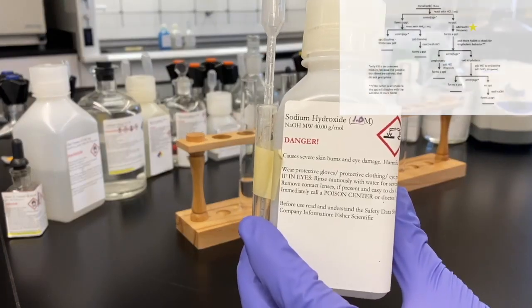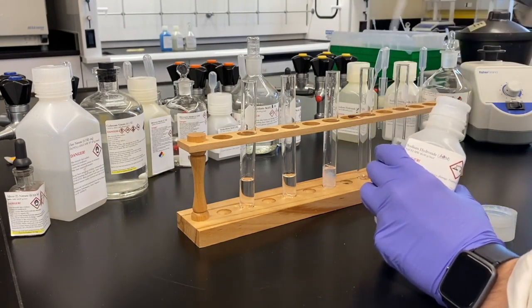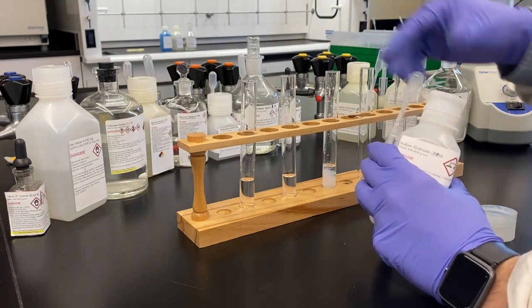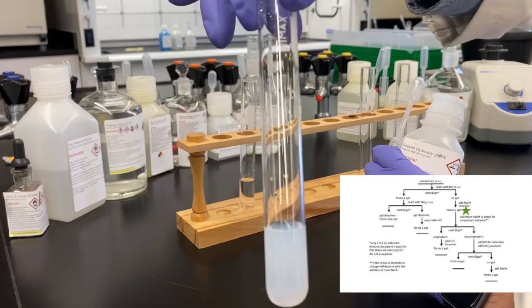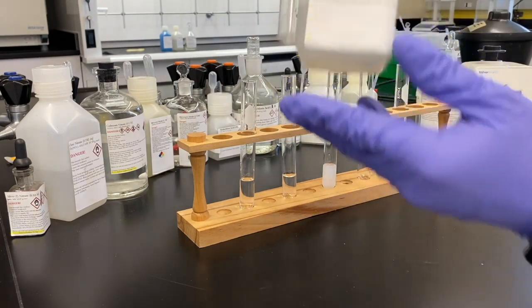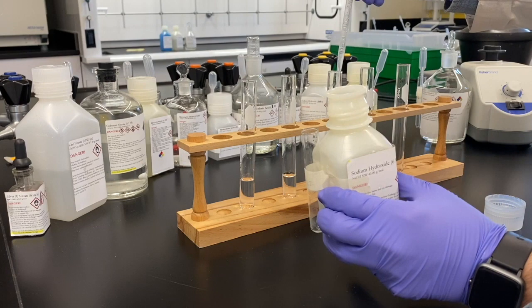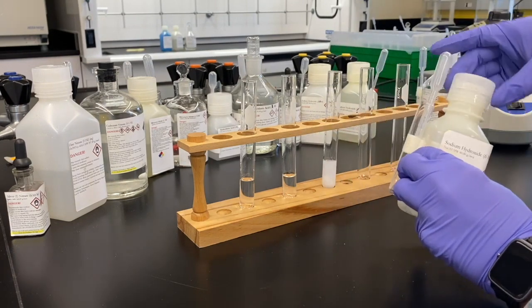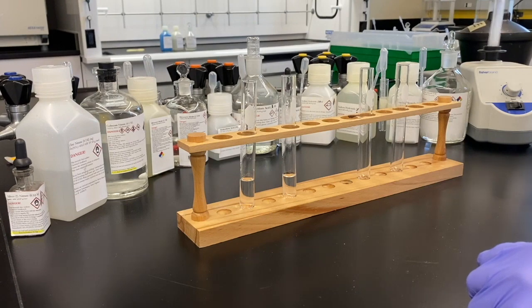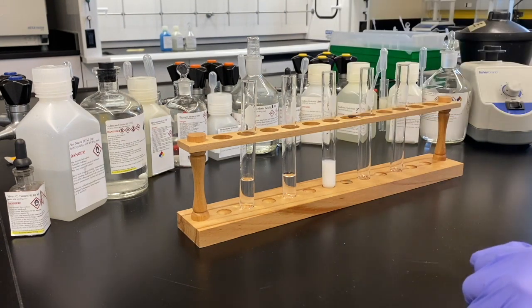But again, from our solubility rules, we could predict that cadmium hydroxide would be insoluble. And when we add our base, we can see that, yes, we are getting a precipitate. So, confirmation of our suspicions. Now we'll up the ante with some more concentrated sodium hydroxide to see if cadmium hydroxide is also amphoteric, like our zinc was. It doesn't appear so. Nope. More addition of base, it's just still solid suspended in solution there. So now we're moving down the right side of our second branch.